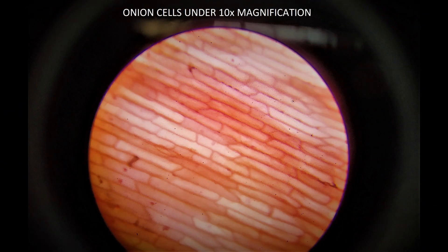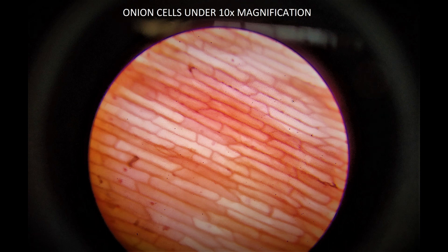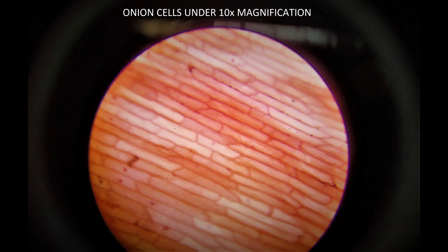After completing the process, now we need to observe the onion epidermal cells under the 10x objective lens, and then we will observe the onion epidermal cells under the 45x objective lens.